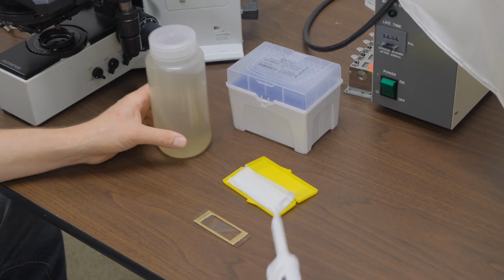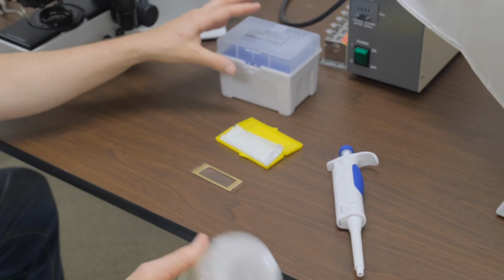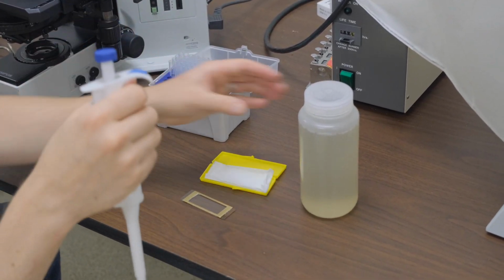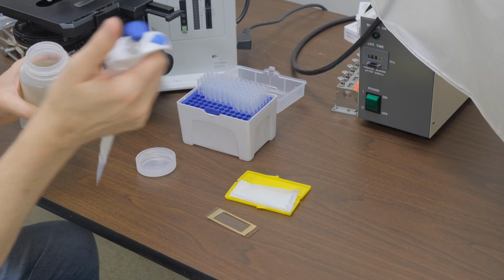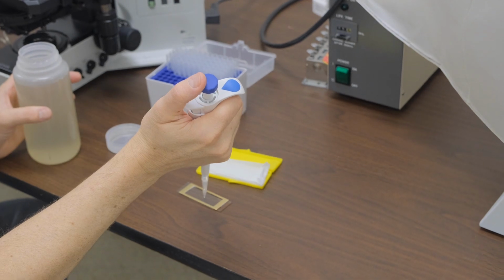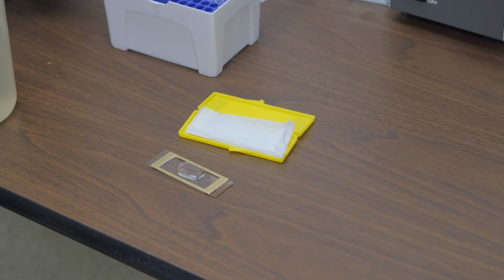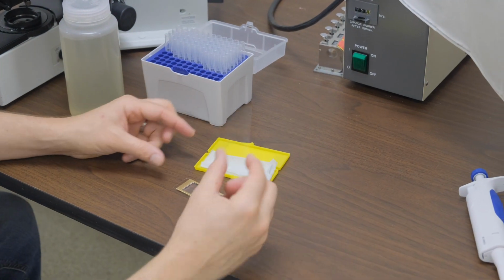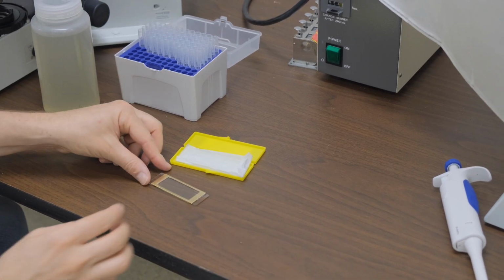We're going to take a milliliter of water from our sample using a pipette here. Make sure it's well mixed. And so we'll take a milliliter from our sample and add it to the Sedgwick rafter here. And we will put the cover glass on the top. We'll have to be careful not to include any bubbles.